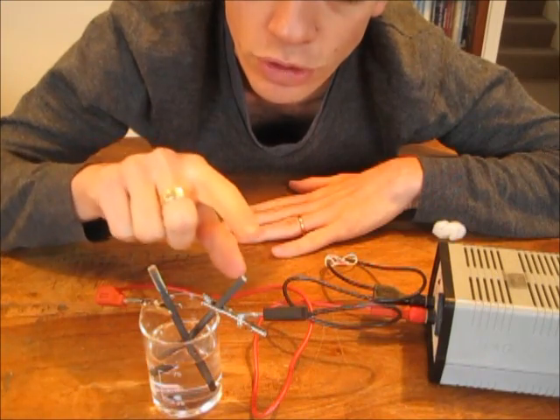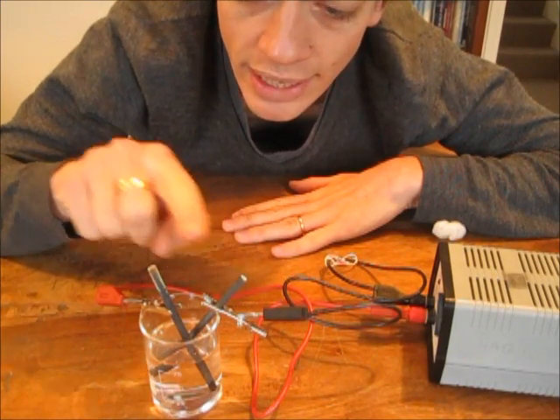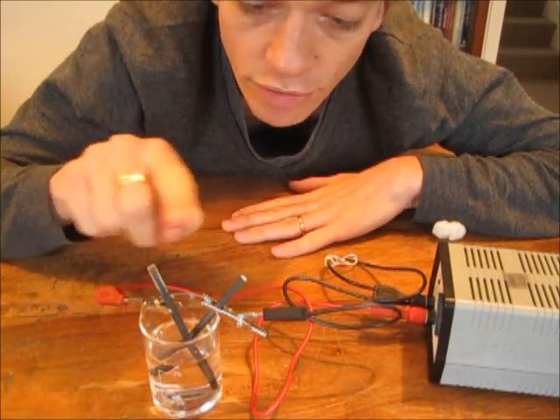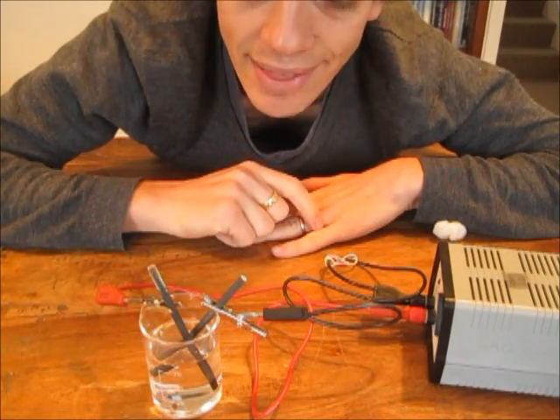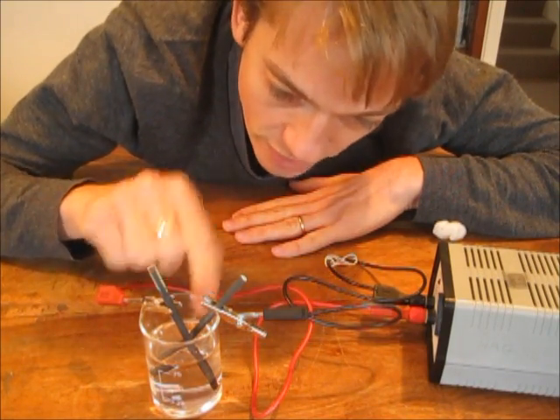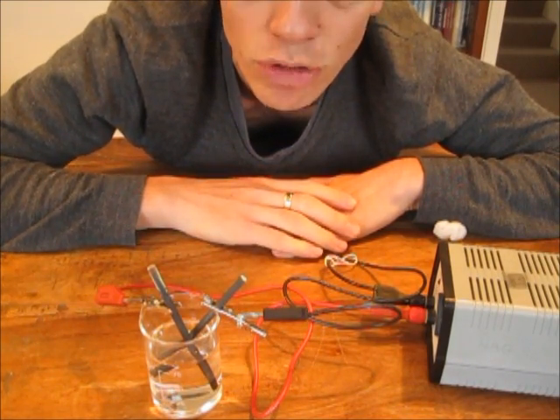I have my two electrodes here and here. One positive, one negative. And then I have the liquid substance here. That is my electrolyte.